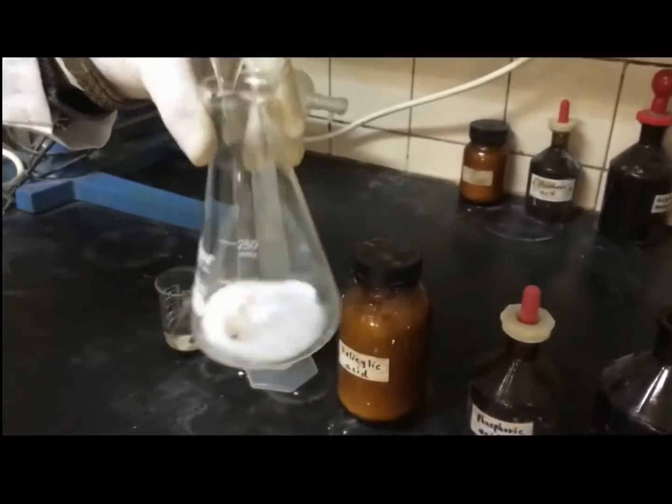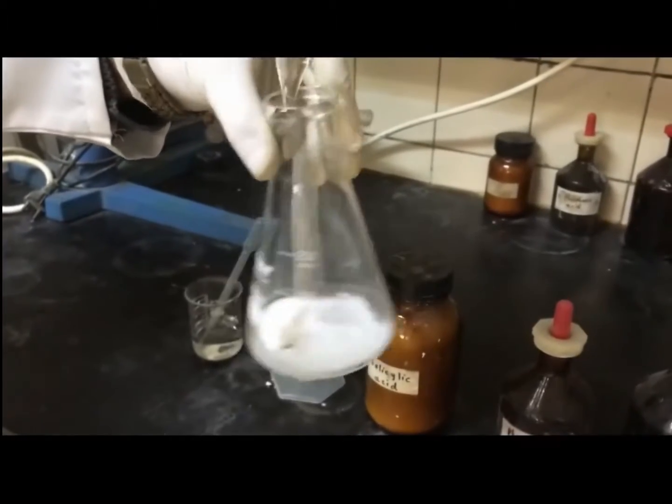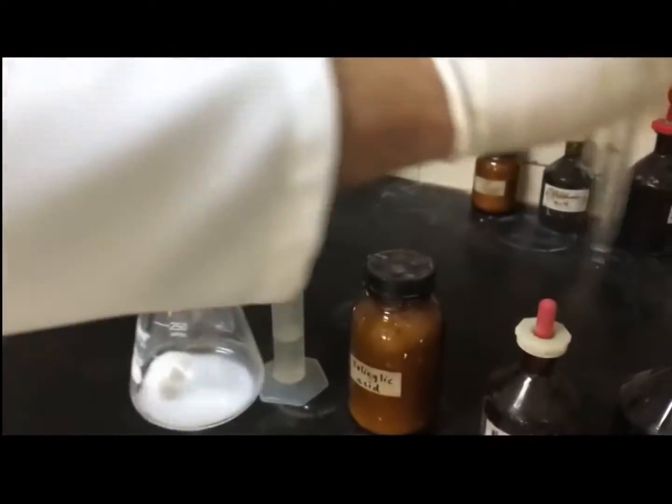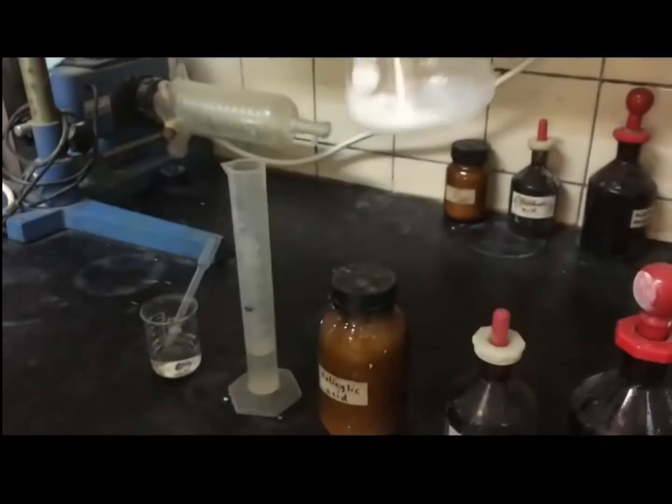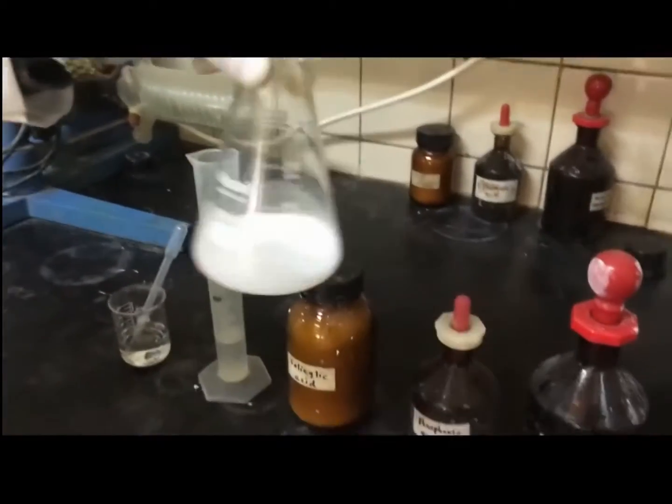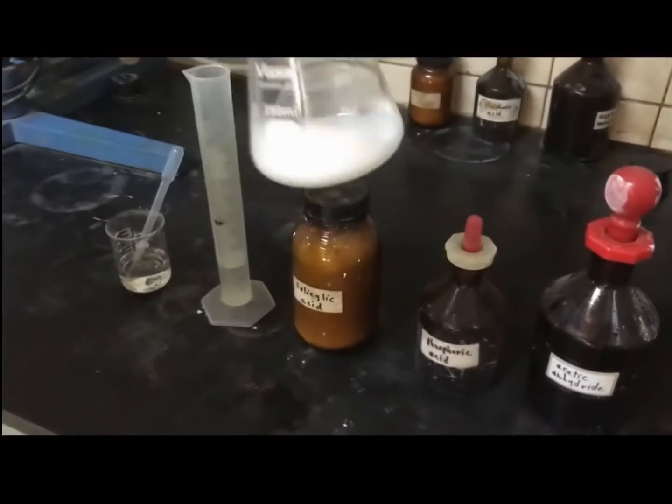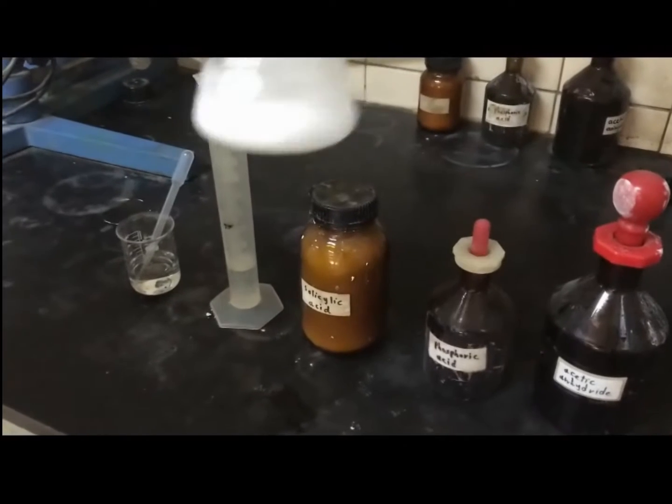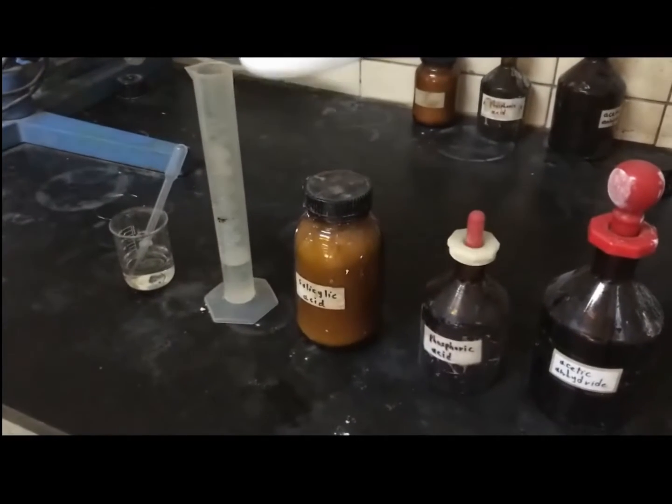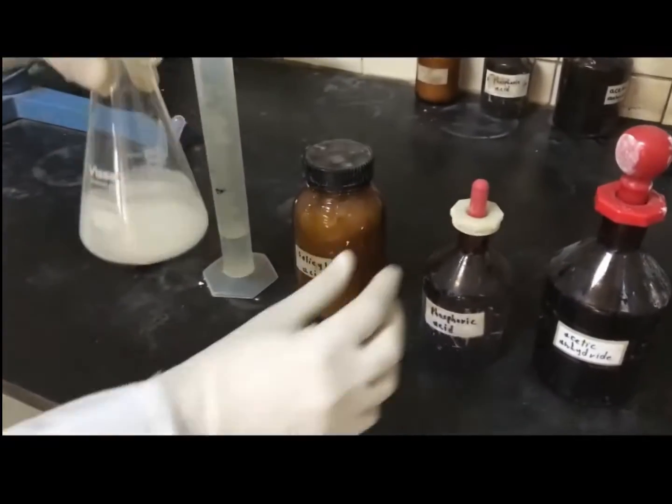Don't forget to shake the mixture. Now carefully add 10 drops of 85% phosphoric acid to the mixture.